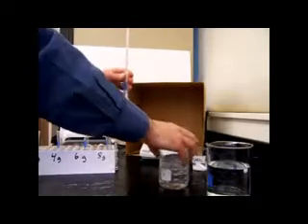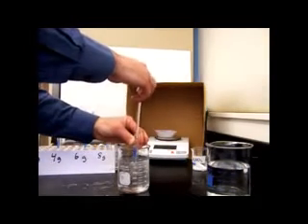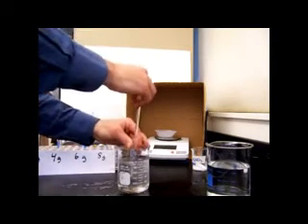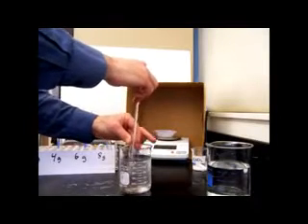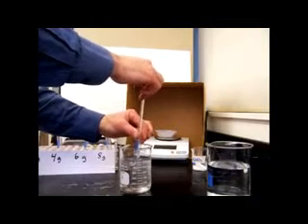To speed this up a little bit, we can use a cold water bath. So we have some ice here, and we'll dip this in and we'll stir it a bit, pull it out, we'll see if any salt crystals are forming. So far they have not. This particular solution has the lowest concentration of the 4 we're going to be testing today. This one has 2 grams of salt dissolved in 5 milliliters of water.